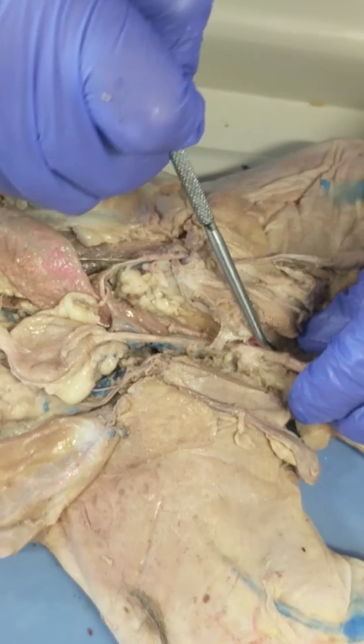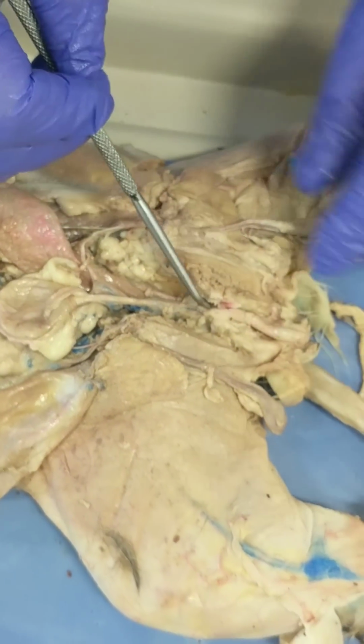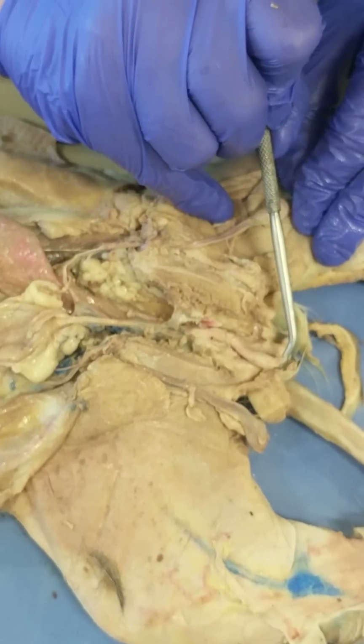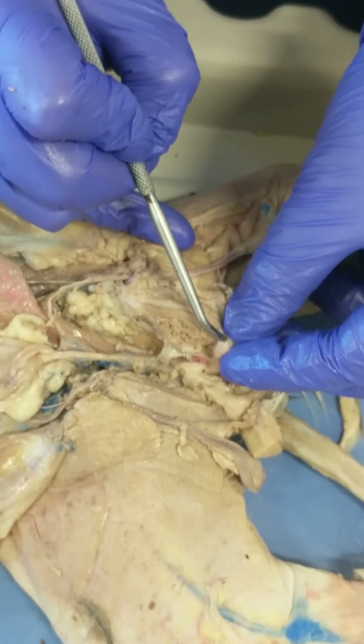So we have kidney, ureter, urinary bladder, and then for the urine to be expelled, it goes out this urethra, which is within the penis, and the penis is this enlarged region right here. So that's the penis, which has the urogenital opening, which I'm pretty sure we will never. Oh, look at that. Kind of see it a little bit.